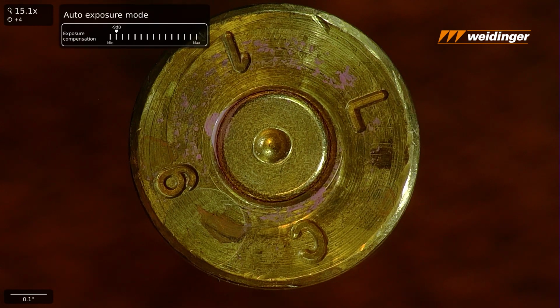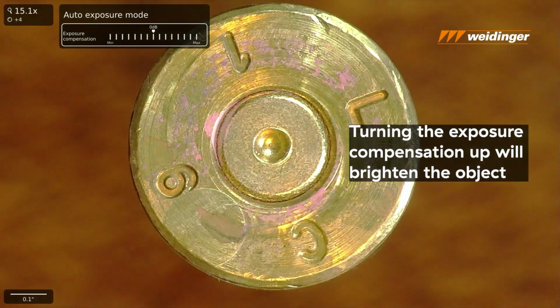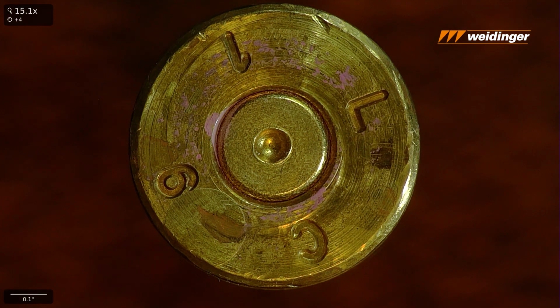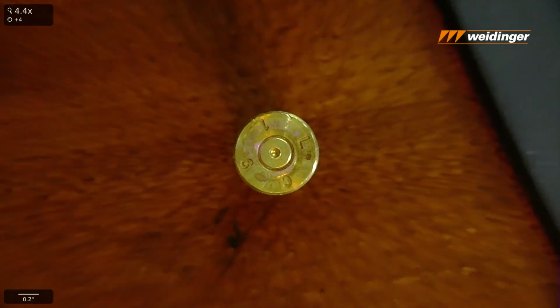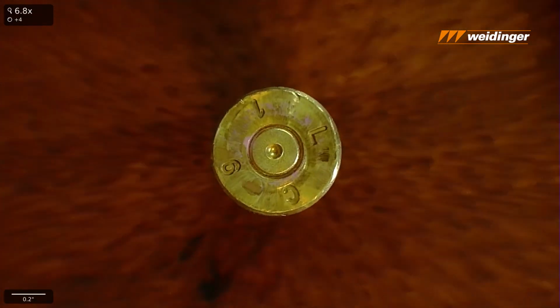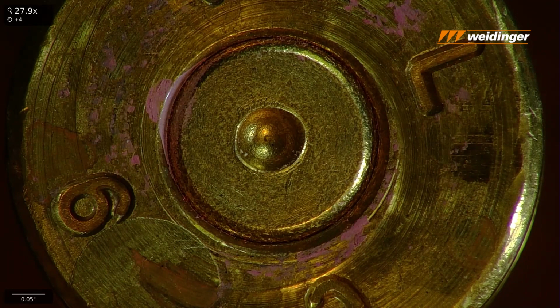to low compensation. If I wanted to tell my auto exposure to be brighter, I can tell it to be brighter, but we get that washed out. Otherwise, I can tell the auto exposure to bias itself toward darker. That way, as we move up and down throughout the zoom range, we still have that auto exposure, but it's compensating itself for a much darker or a much brighter thing to be looking at, which is really helpful, particularly when we start wanting to look at metals, things like that.